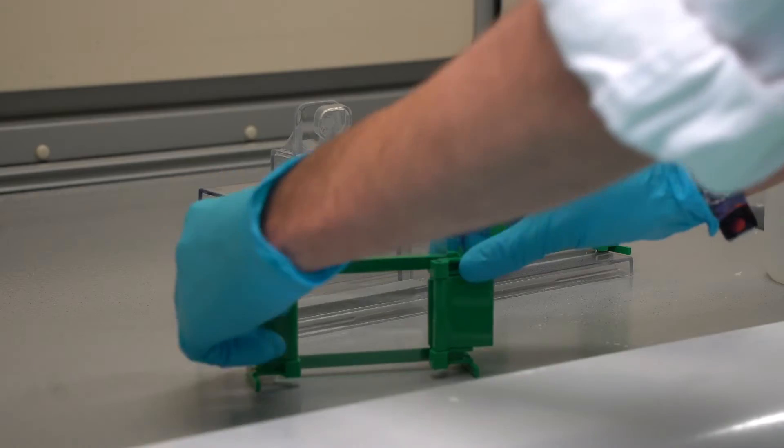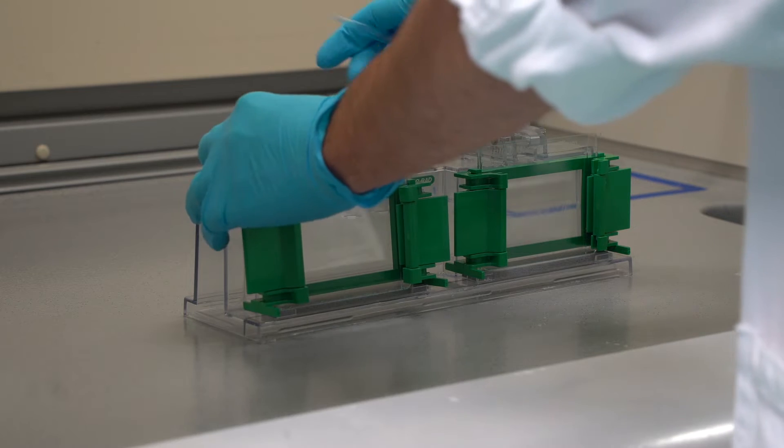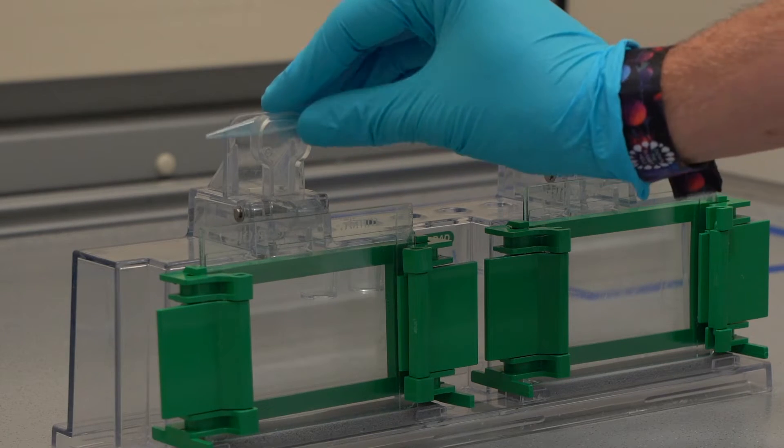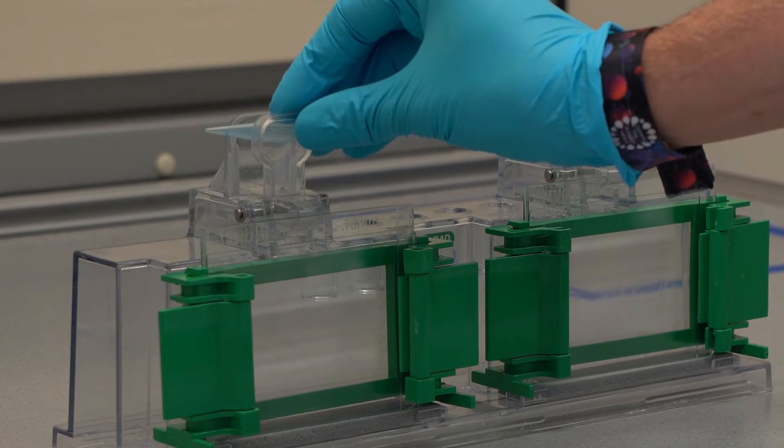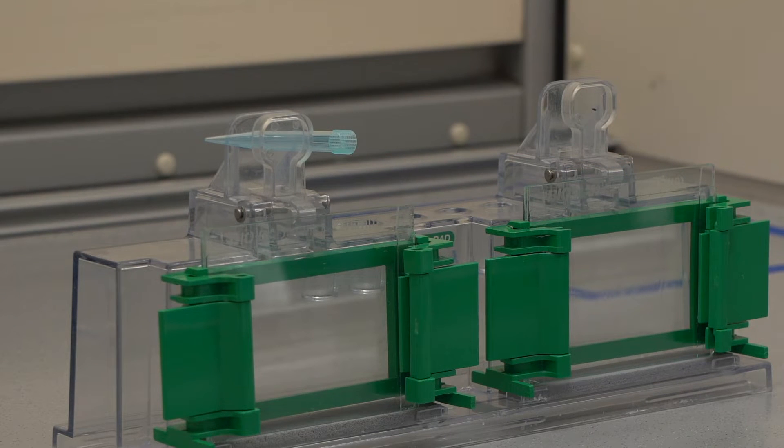Now place the casting frame with the slides in the casting stand. Sometimes you can use a pipette tip between the clamps for extra pressure, but please consult your teacher before doing this.